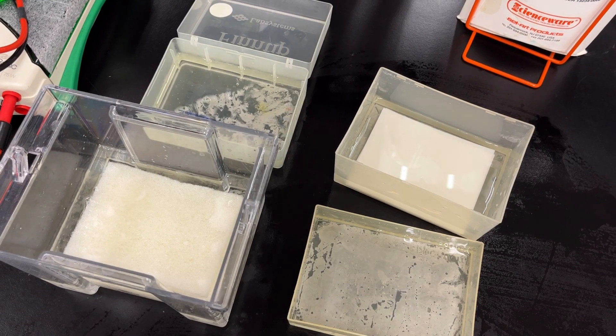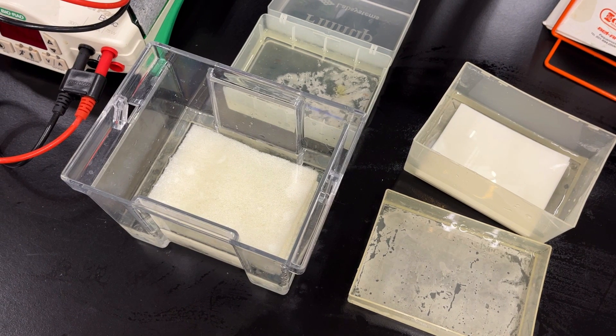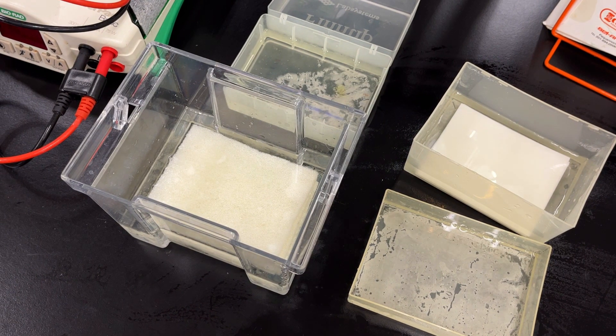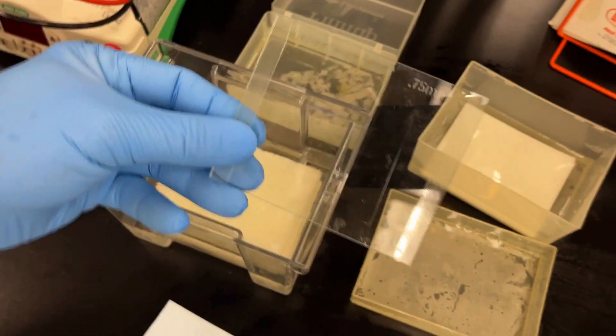Welcome back to our SDS Page Western blot series. Right now we finished our SDS Page gels and they're soaking in transfer buffer. When you're doing a transfer you want to make sure everything is soaking and you also need to pre-cut yourself some membranes.